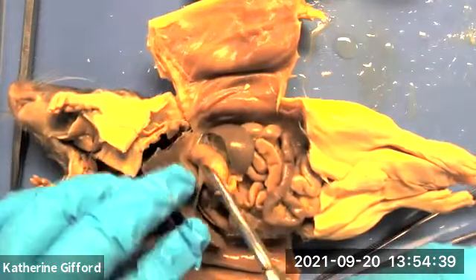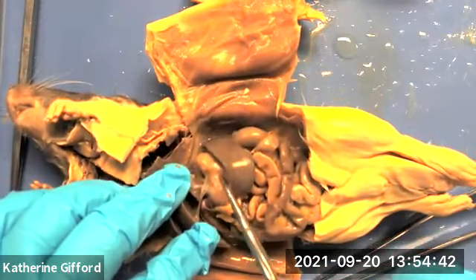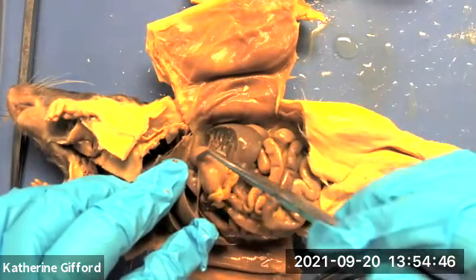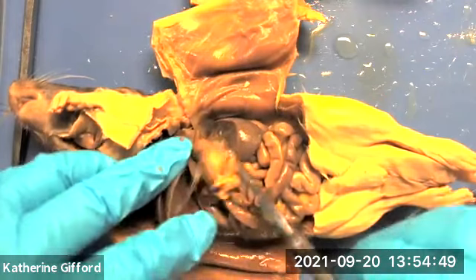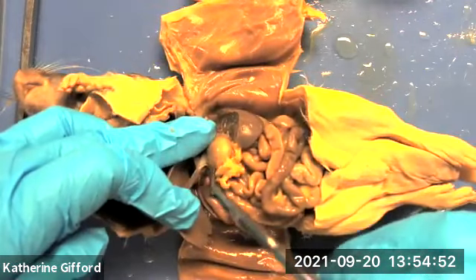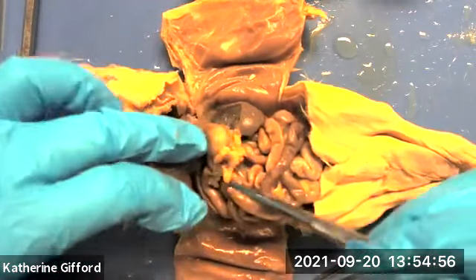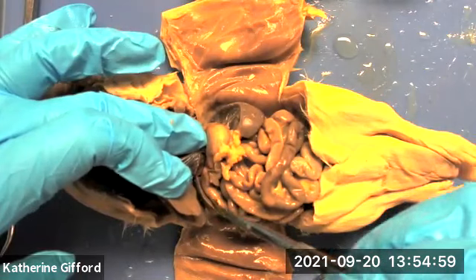The esophagus empties into the stomach. Because of the size of the stomach, we don't get to see every portion, but you can definitely see the body of the stomach and the pyloric stomach where it gets narrow. You can see the beginning of the duodenum.